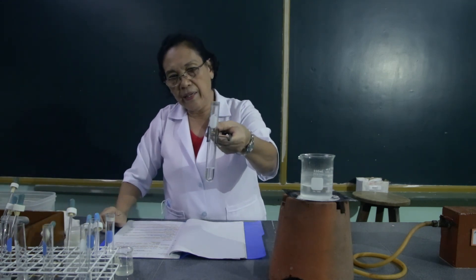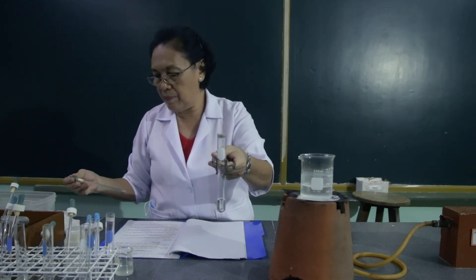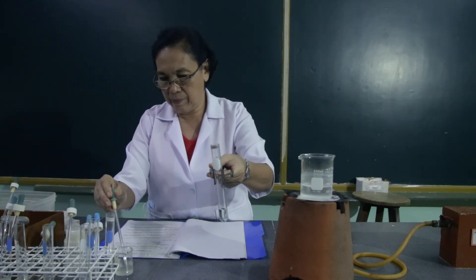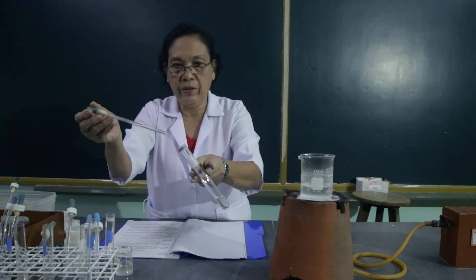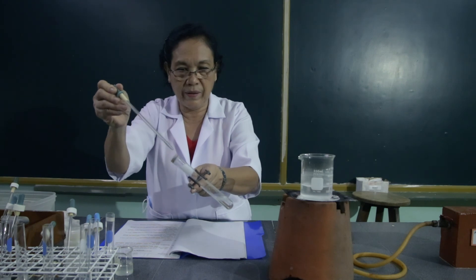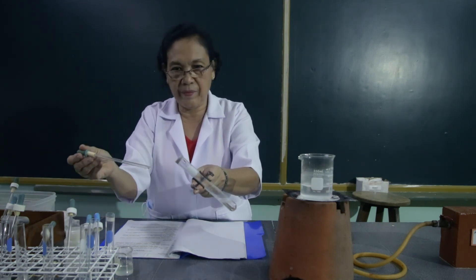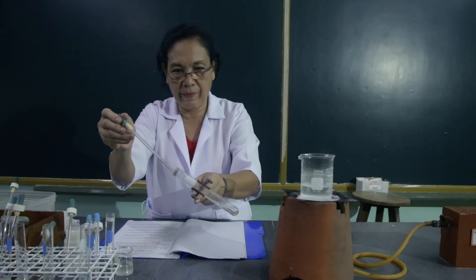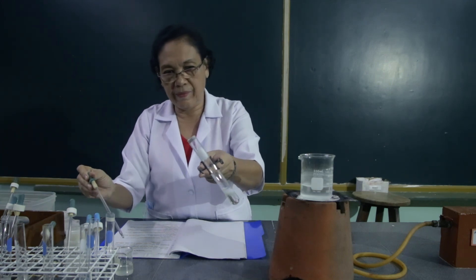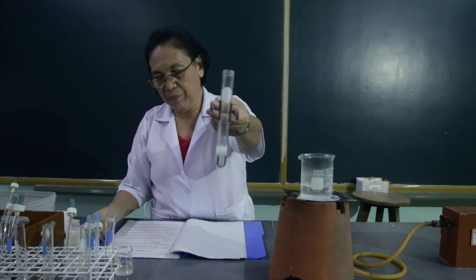Then let's add to this the egg albumin. I want you to observe what happens. What have you observed?